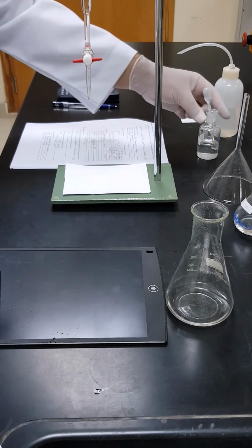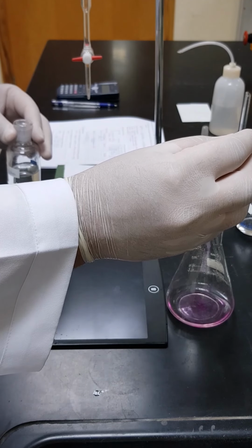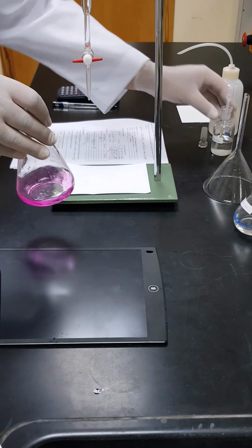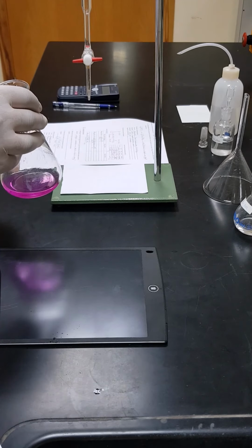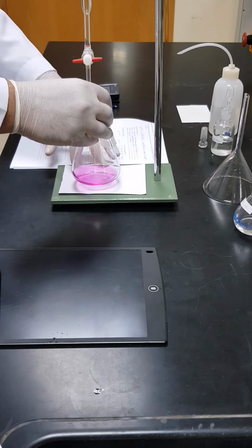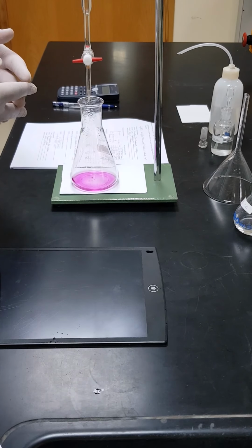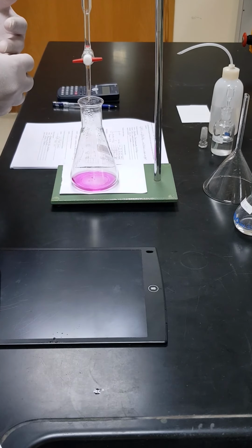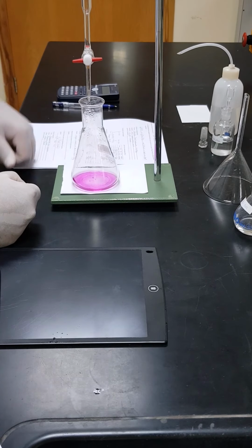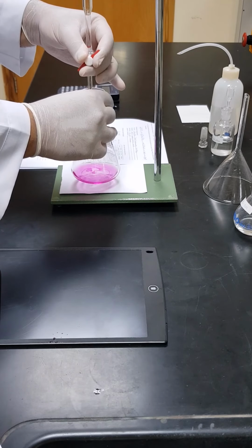And we will add 2 drops of phenolphthalein. Notice that the solution turns pink because the medium inside is now basic due to the presence of the remaining amount of sodium hydroxide, and now we are going to start titration of that amount. Of course, this time we will not do the rapid titration and slow titration method, because we already boiled the sodium hydroxide with ammonium chloride, and it would take a lot of time to reboil again. So we will just go slowly, drop by drop, from the beginning. Okay, let's start.